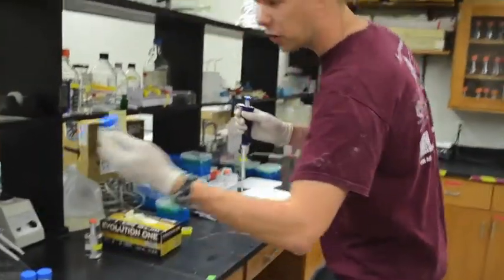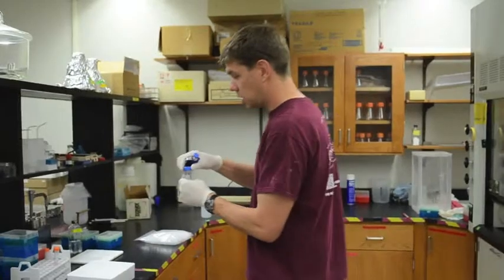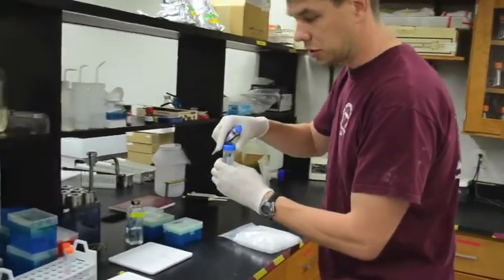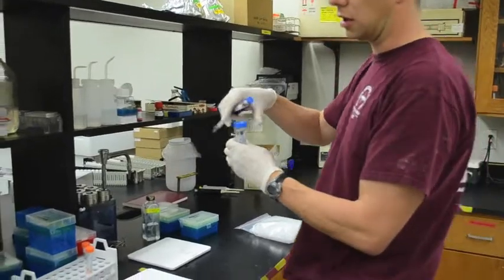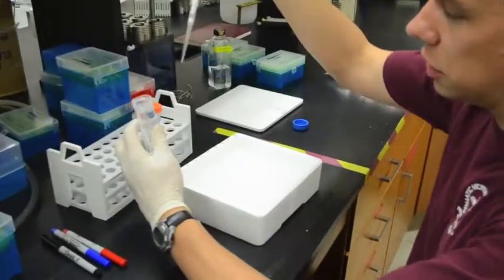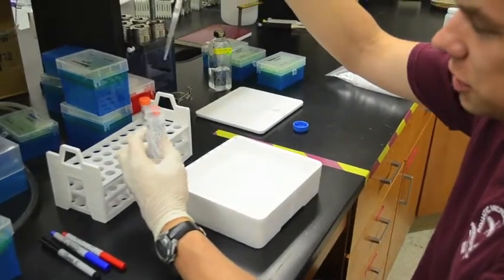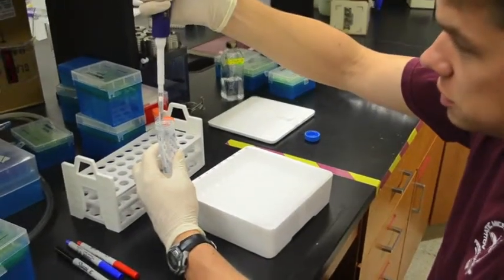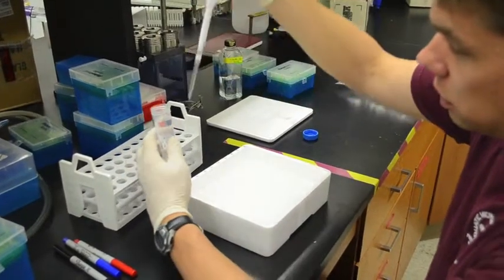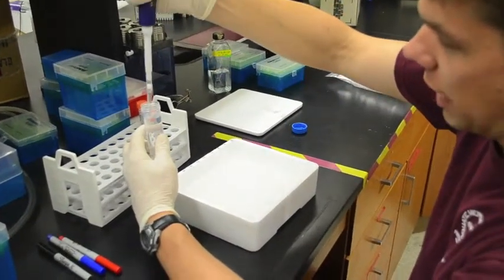So first I'm going to take my live water and add 1 milliliter very carefully to each cuvette. I'm actually sitting down to do that. I find in a lot of cases, you don't want to add something to the same cuvette twice. So a lot of times I'll put my little finger on the column that I'm adding to.